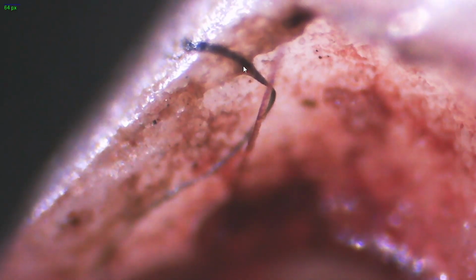Okay, it's now flipped over, and so we can start to see kind of into that root tunnel right here. Again, all this blood covering the outside of the tunnel. And you can kind of see the inside of it. Not the best here, but again, apologize for all the blood. It is dried, it's not leaking, but we got this whole tunnel all the way around. And this is where the root would be, underneath the gum.